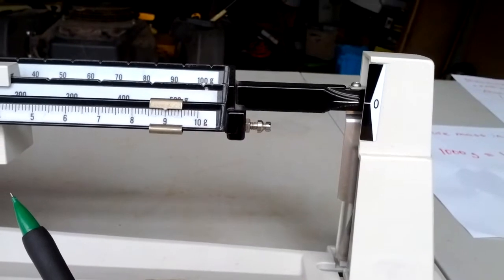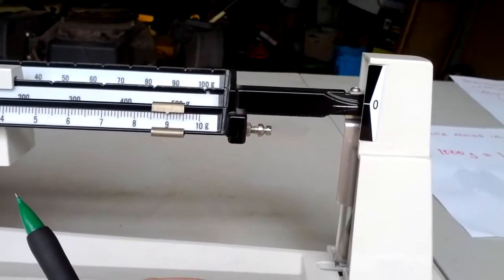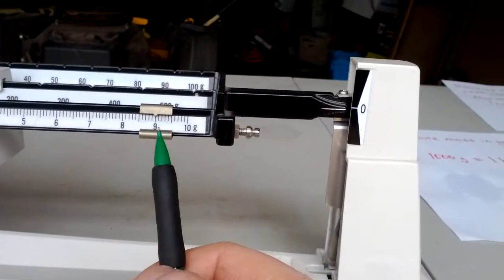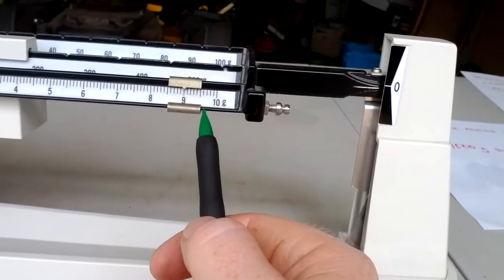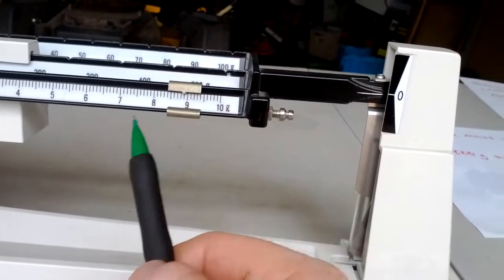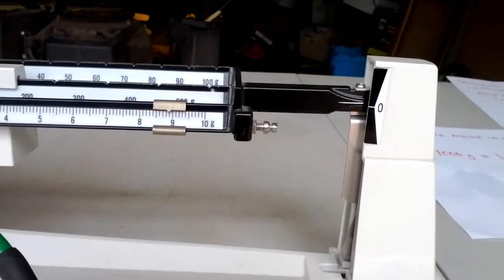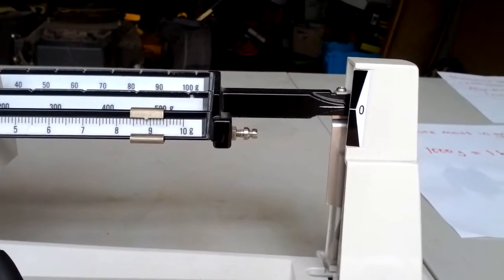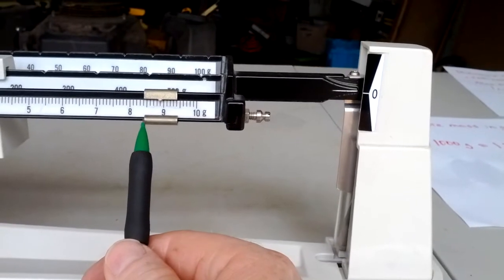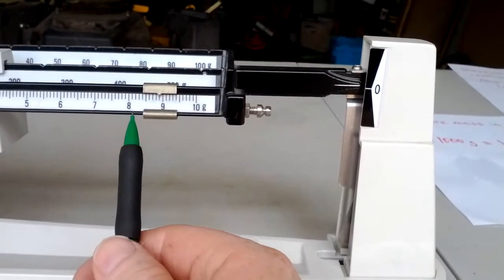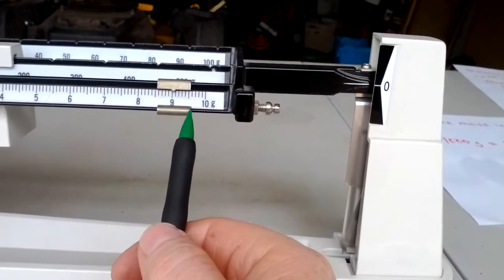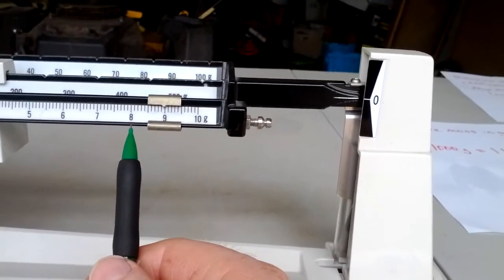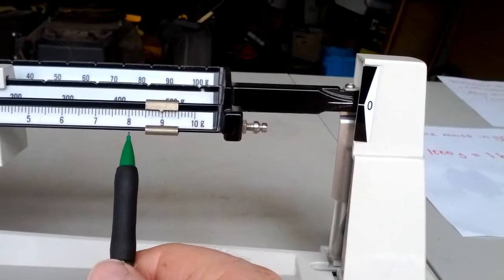So I'm going to go back to 9. A little bit too much. See? It went right down below. It's almost there. It's really close. So I'm going to go down one more tenth. Now, that's almost there. Just a little bit more. Right at 9. I'm pretty sure that's it now.